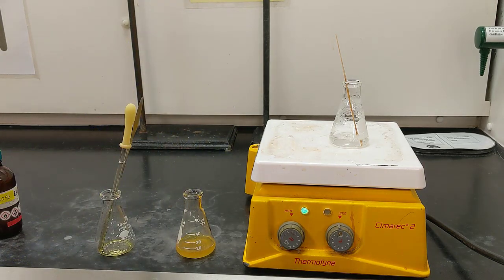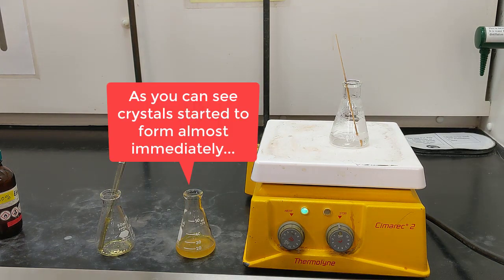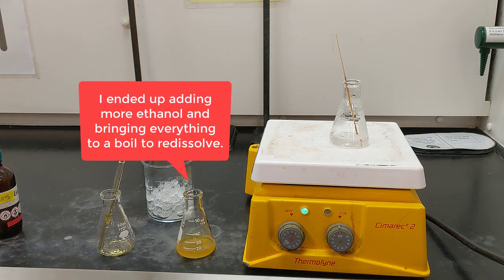Alright, and now that I have that sitting in there, I'm going to let it cool to room temperature. And then after that, to encourage crystal formation, I'm going to put that in my ice bath. So let's wait a minute for it to get to room temperature.